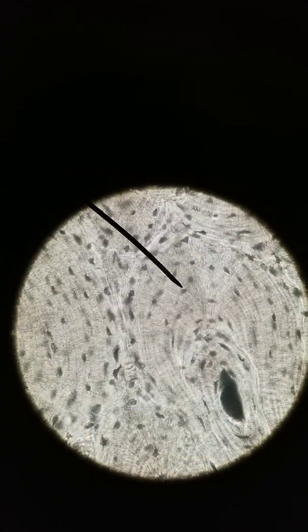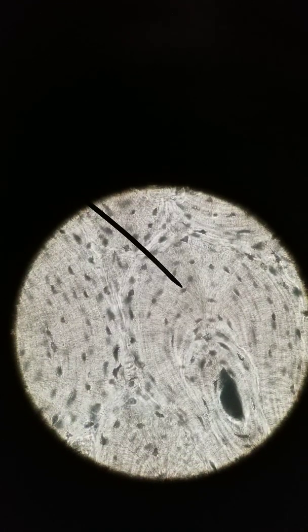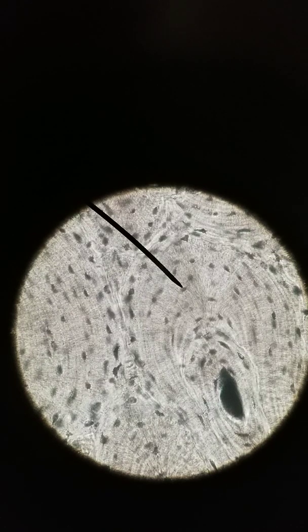The cells are what are darker here. So that cell that I'm pointing at, that's an osteocyte. Osteocytes are within spaces, just like what we saw with cartilage, though, and you can kind of see it here, there's a little bit of white space surrounding it. Osteocytes sit within lacunae.